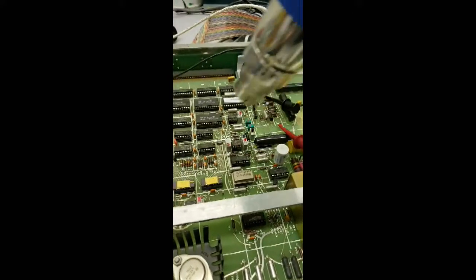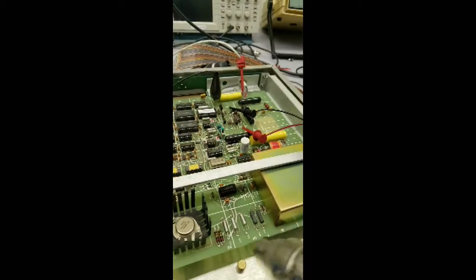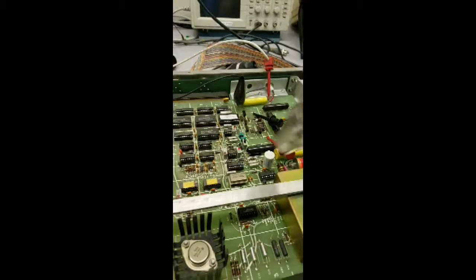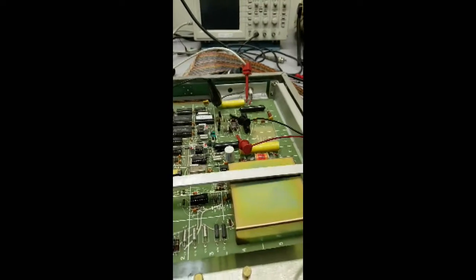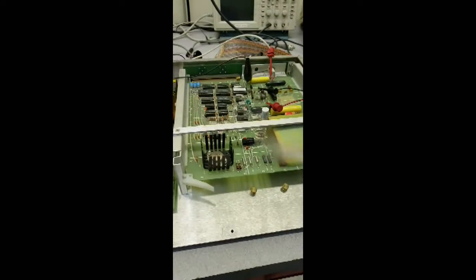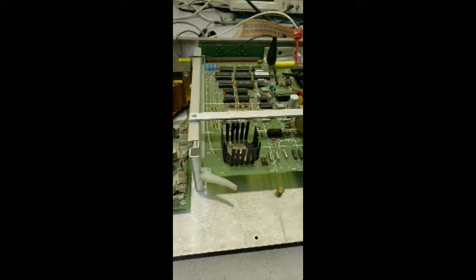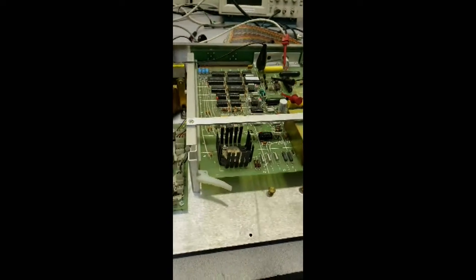In this case, if it gets overheated, it actually stabilizes. It's only failing in a certain range of temperature. All right, let's try to cool it down from a distance and get it in the temperature range where it'll fail. By the way, I'm just using freeze spray.